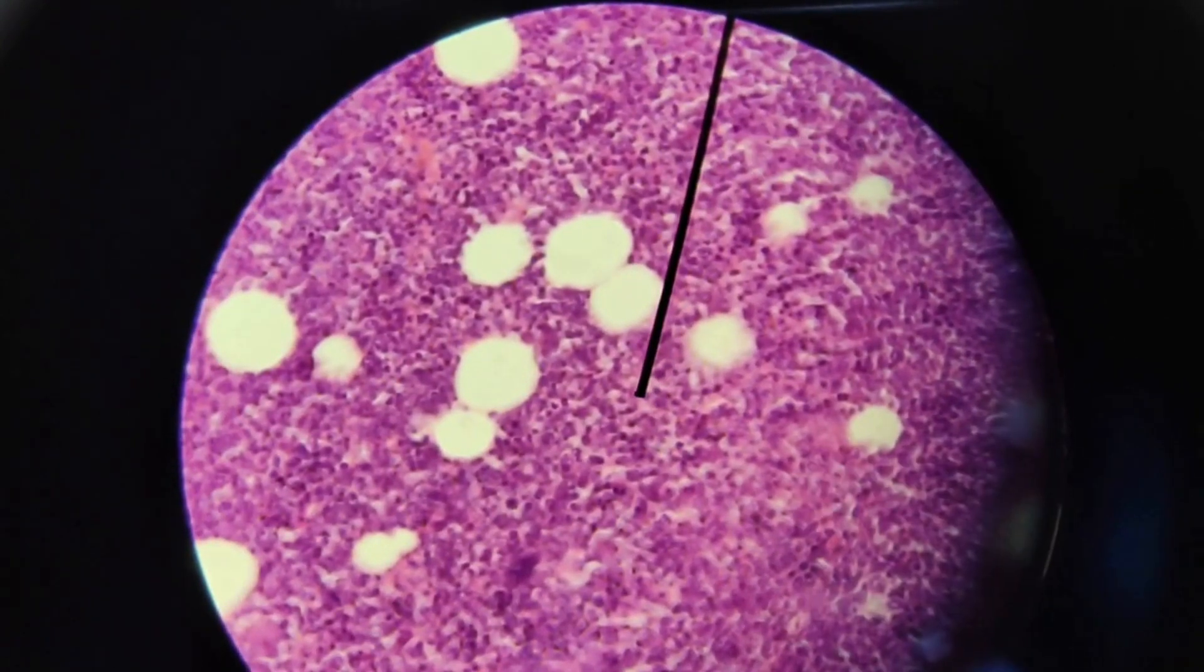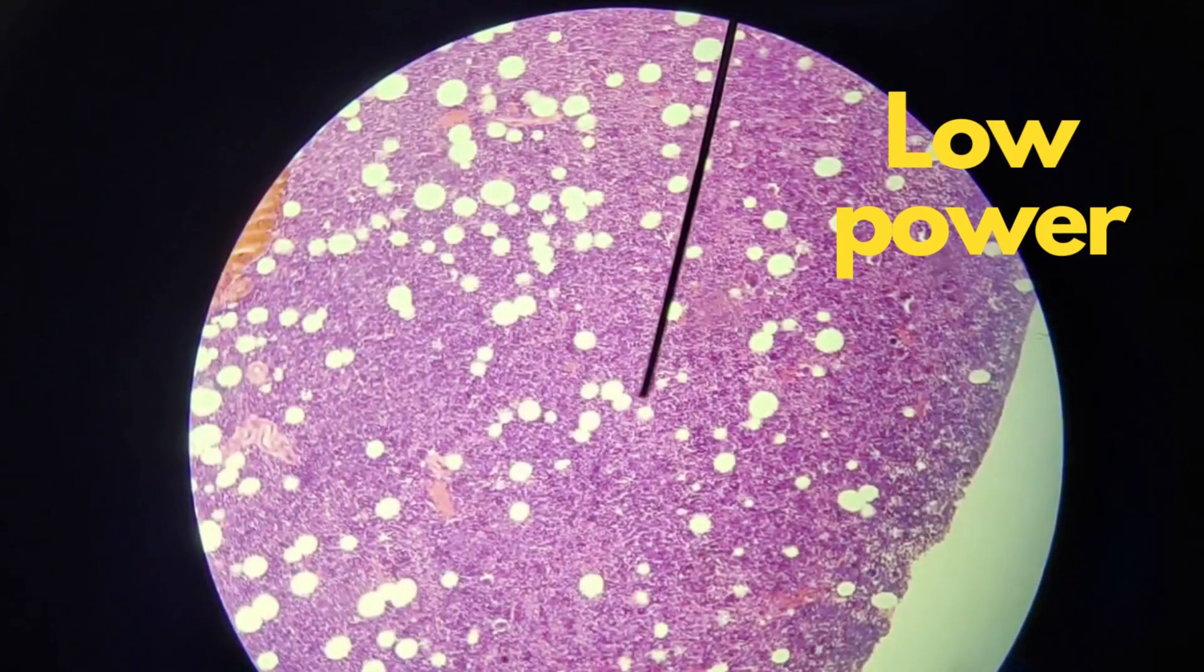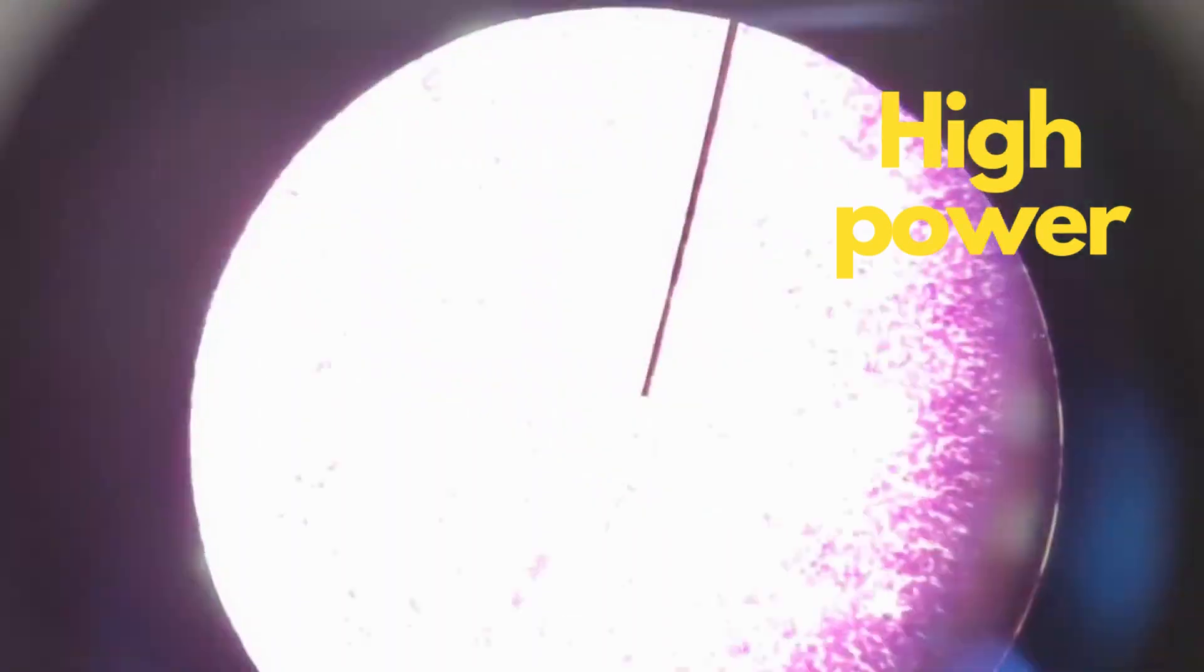That's how you view from low power to high power objective.